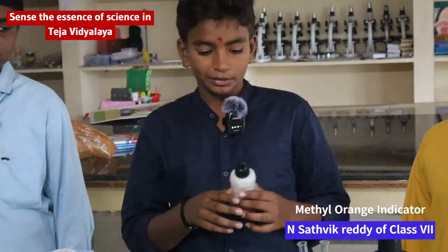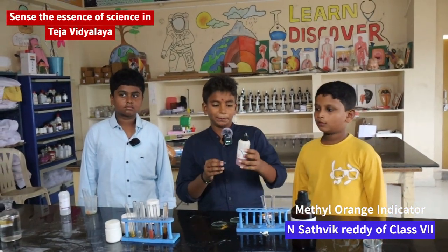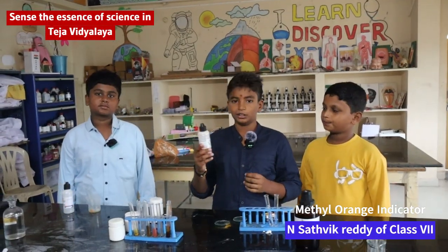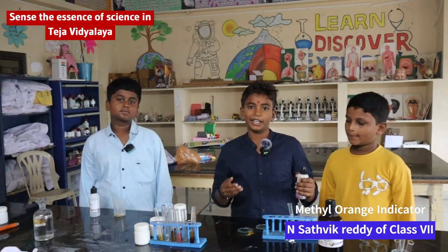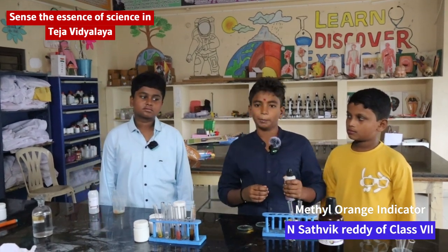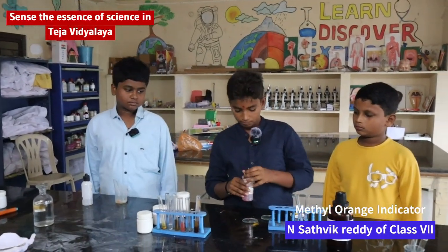Now I am explaining the indicator methyl orange. Methyl orange is a pH indicator. It is orange in color. It will change its color with strong acidic gases like HCl. Now I will show you.